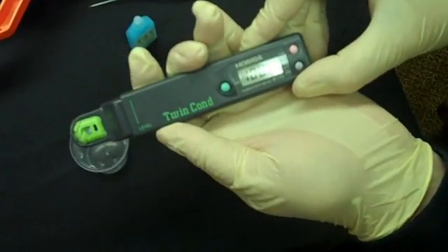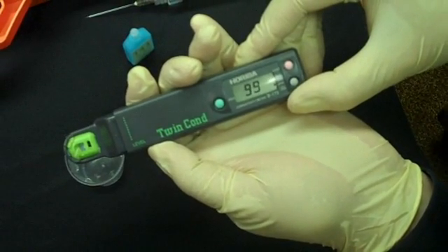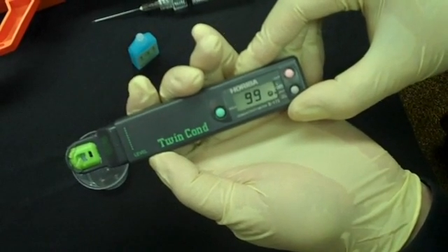Turn the gauge on, and it's going to start reading automatically. Once it has finished reading, a smiley face will appear on the screen. There we go.